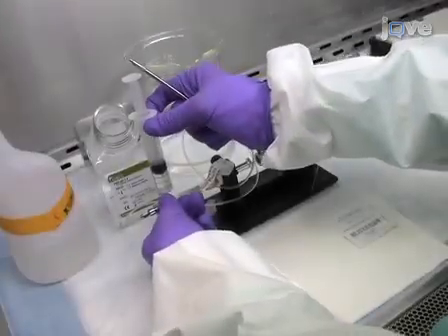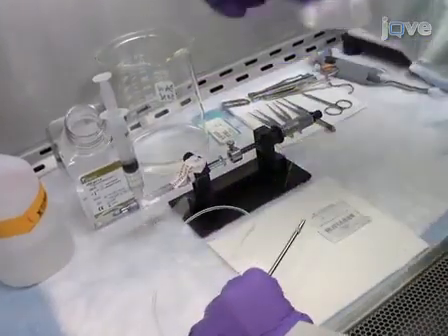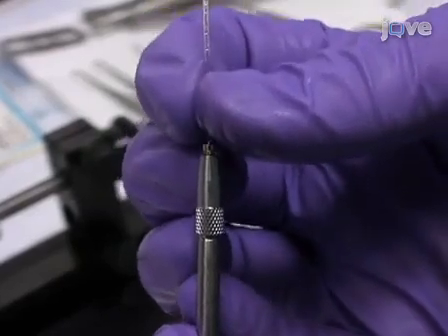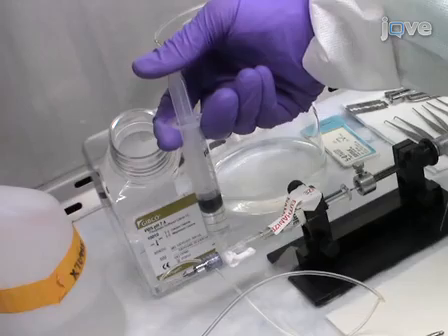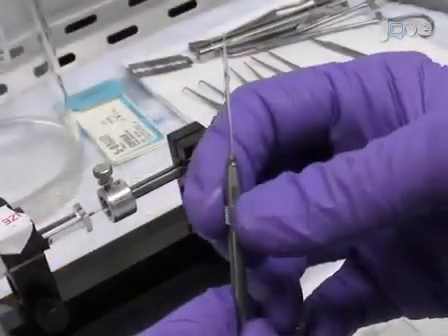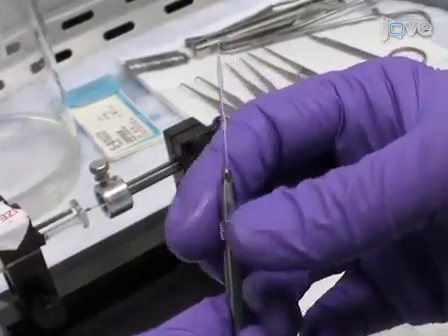Connect the needle to a 25 microliter microsyringe mounted in a manual infusion withdrawal pump. Place a beveled and sharpened microinjection needle into a pipette holder. Apply light pressure to a 10 cc syringe filled with mineral oil in the upper part of the stopcock to flush oil into the tubing, microinjection needle holder, and needle, and draw oil into the microsyringe. Make sure not to introduce air bubbles.